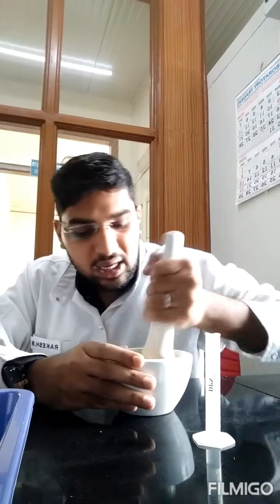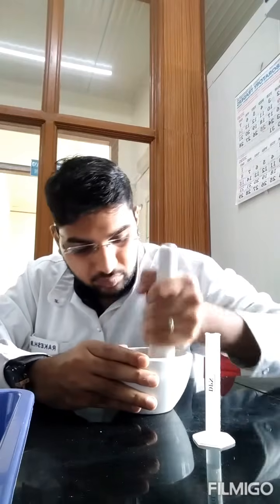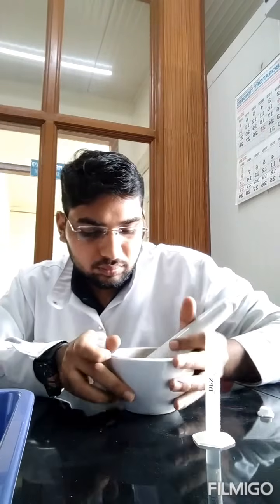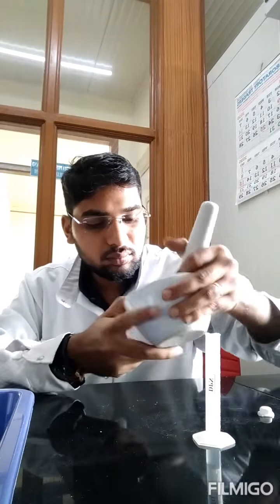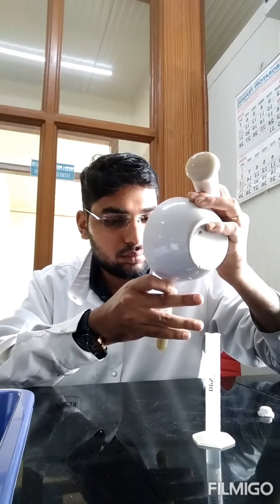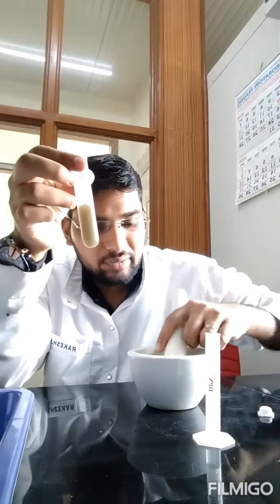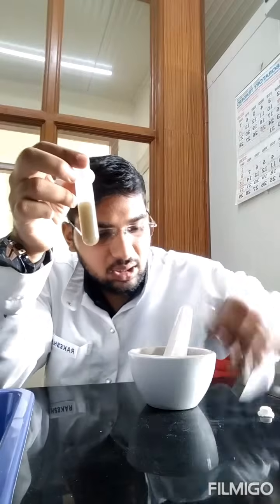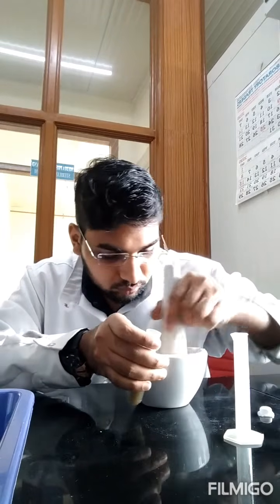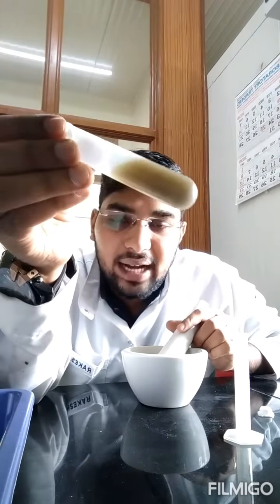So take the fresh material and grind it properly using this aqueous sulfosalicylic acid of 3%. So now I'll be transferring it to a centrifugation tube. I will transfer it. So I have transferred everything to here. Just another 2 or 3 ml is left out. Whatever is there in this pestle and mortar, I can just rinse with this and add it here. So now you cannot see the plant. I have ground it so well.